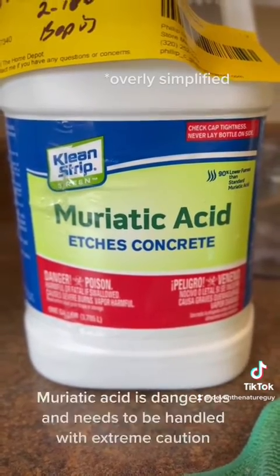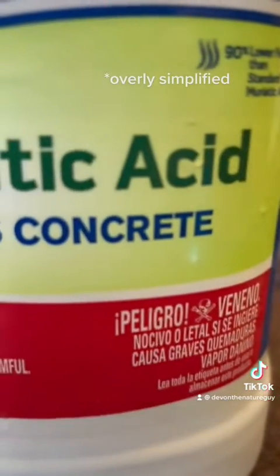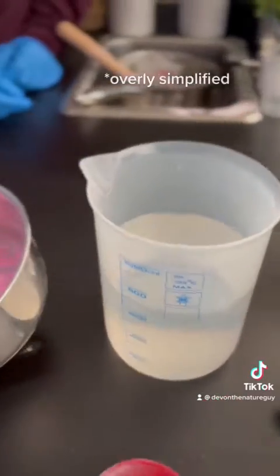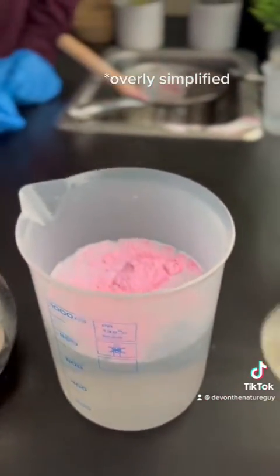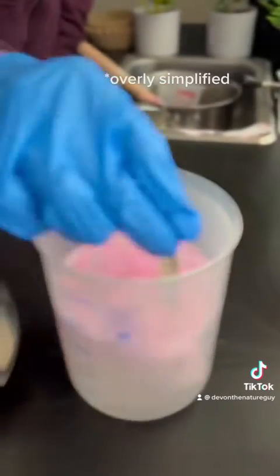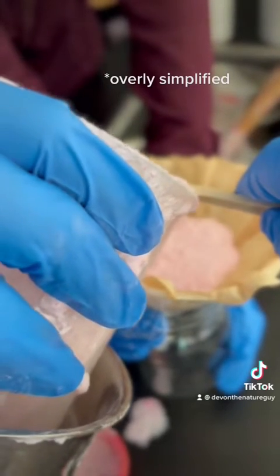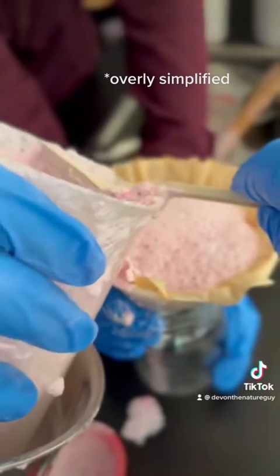...add about 100 mils of muriatic acid — it's basically store-available hydrochloric acid, kind of potent stuff. Set up a couple of containers with funnels. Slowly add the Pepto-Bismol to the muriatic acid solution, and be careful because it's going to froth up a lot. Place a coffee filter in the funnel and slowly filter out the liquid.